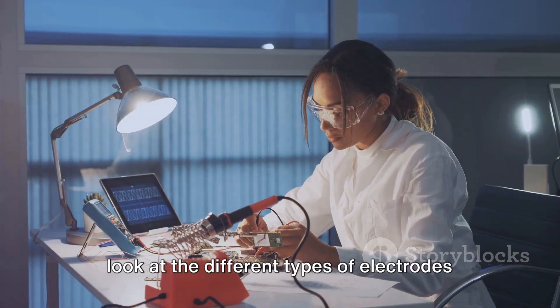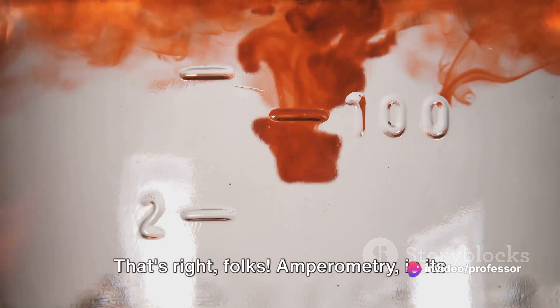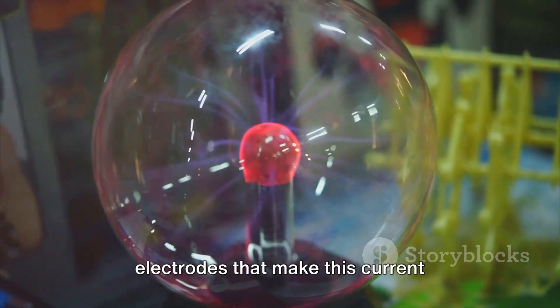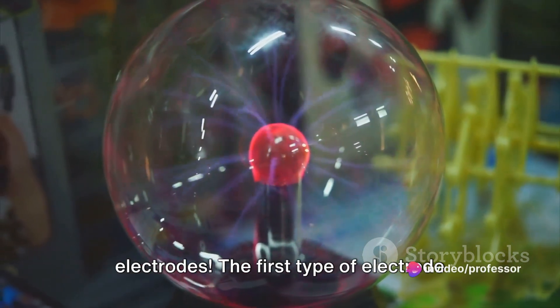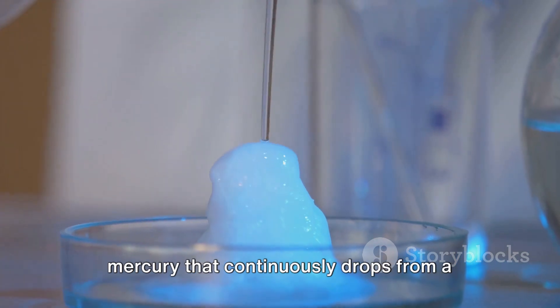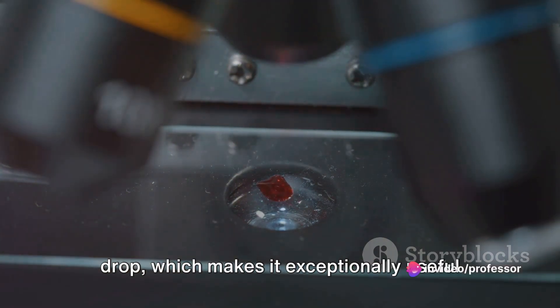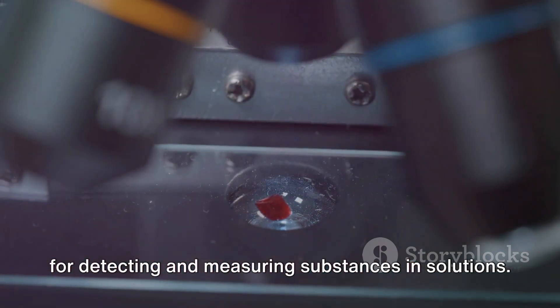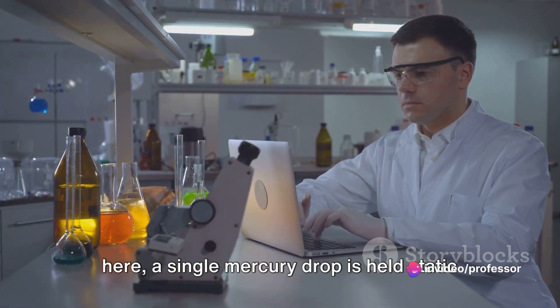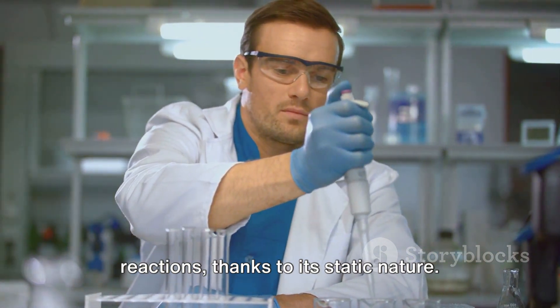With the principle in mind, let's look at the different types of electrodes used in amperometry. The first is the dropping mercury electrode, or DME — a fountain of liquid mercury that continuously drops from a capillary tube. The DME provides a clean new electrode surface for each drop, making it exceptionally useful for detecting and measuring substances in solutions. Next is the static mercury drop electrode, or SMDE, where a single mercury drop is held static at the end of the capillary tube. The SMDE is particularly efficient for studying very slow electron transfer reactions.